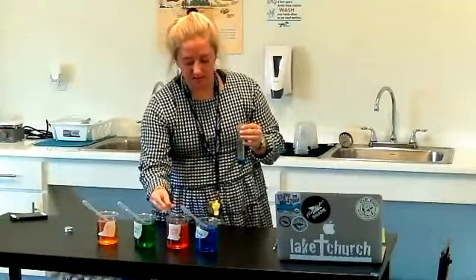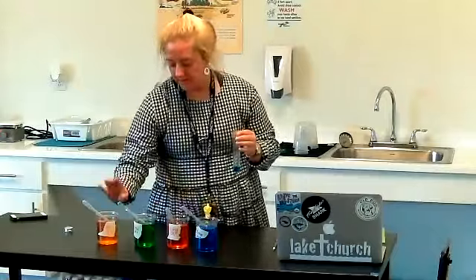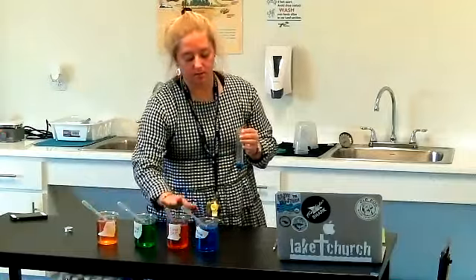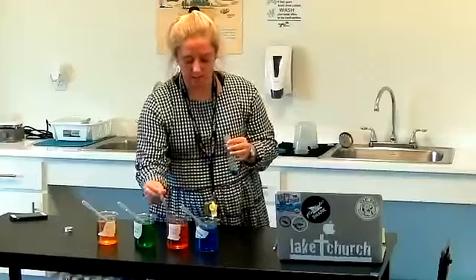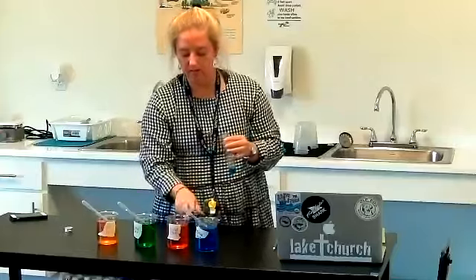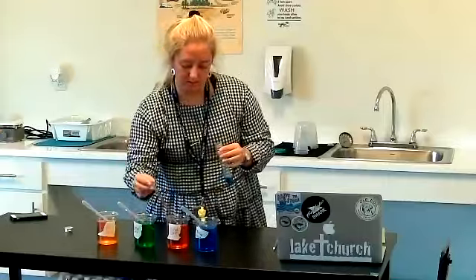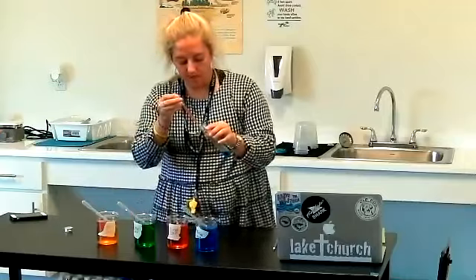Now I'm going to do the next one. If you were recreating this at home, I would say don't put any salt in one of them. This one I put about one scoop of salt, this one has about two scoops, and this one has about three — it's a nice easy way to get your moles. The important thing if you're recreating this is that the water level in each container is the same, so the salt dissolves in different concentrations.